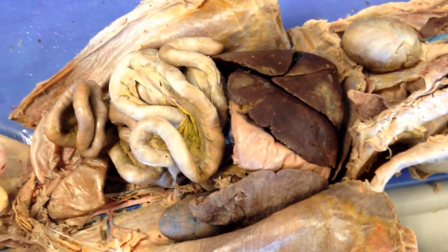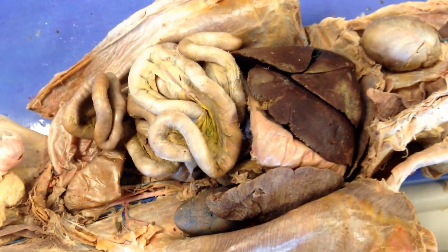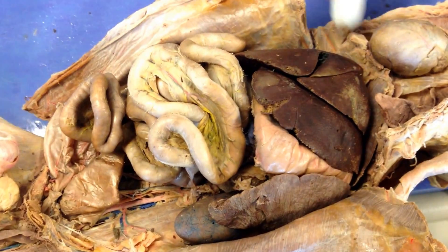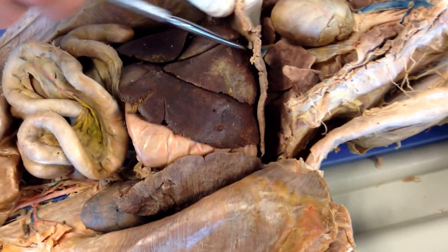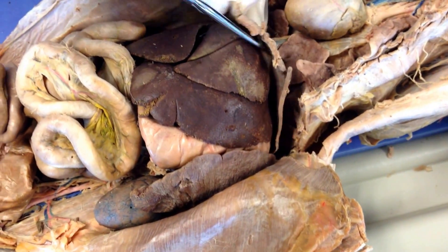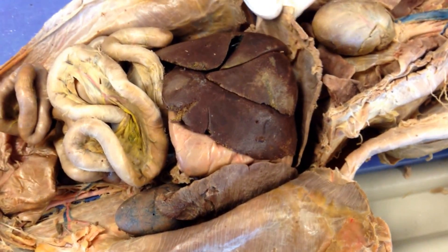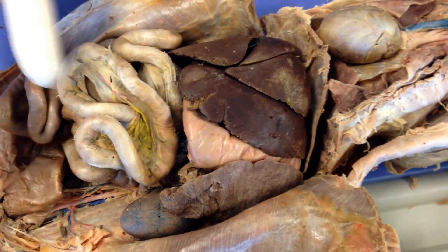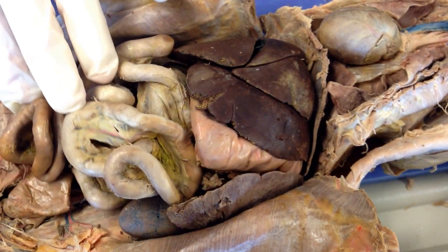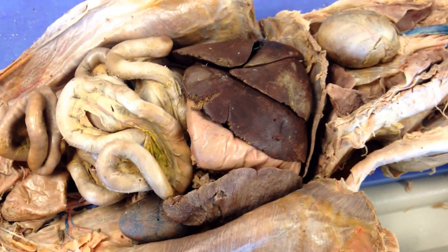Let's take a look at the digestive system on the cat. The first part to learn about is the diaphragm — that's just the big wall here. It's not part of the digestive system, but it's a landmark for us. The greater omentum was a big pile of fat that covered everything, and you should remove that right away when you first start the digestive system.